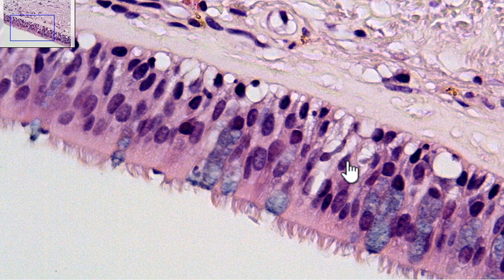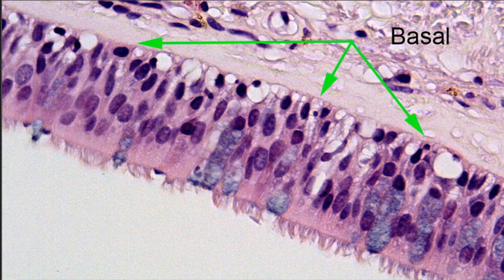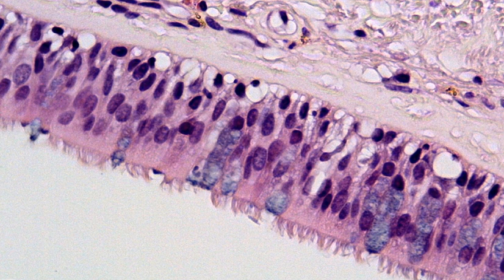If we keep on going down, we'll notice right along here, this thin edge is the end of your ciliated pseudostratified columnar epithelium. That's the basal surface. So down here is the apical, up here is the basal. Remember, all basal surfaces are supported by connective tissue. The actual cells themselves, even though they're only one row, they look like they're multiple, hence the term pseudostratified.